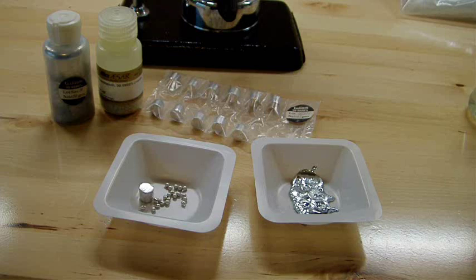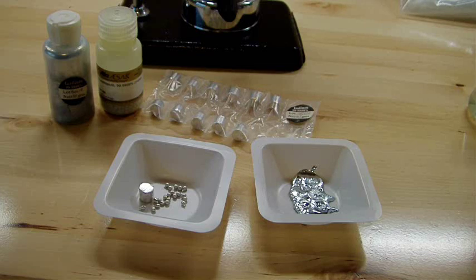Today I'm going to be making a liquid metal alloy called Galinstan out of gallium, indium, and tin metals. I've done this before with low purity stuff and it didn't come out quite that well.